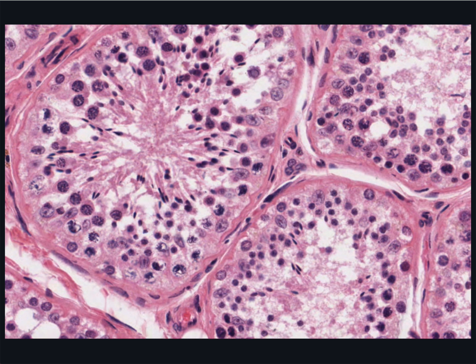Now let's look at the spermatogenic cells. Spermatogonia may or may not be abundant in any particular region of the epithelium. They always lie on the basement membrane and are often very flattened cells. I can't see any in this particular image.